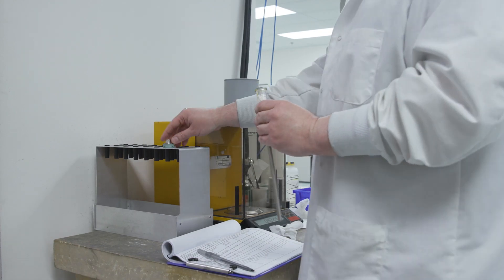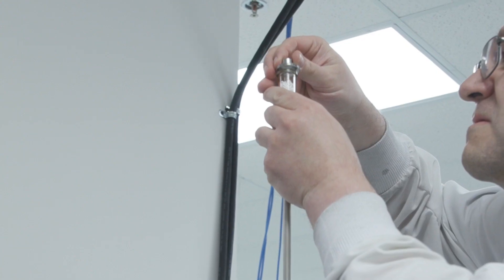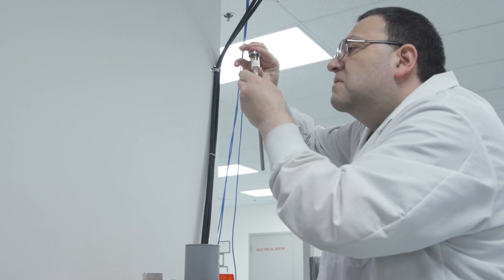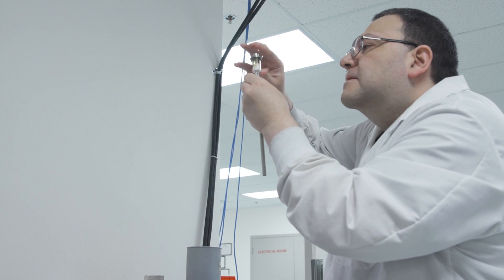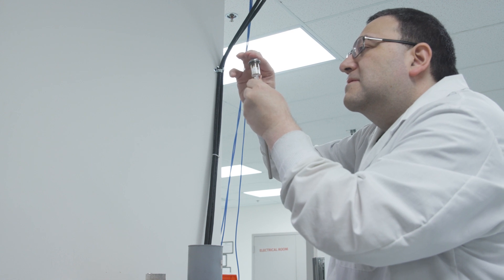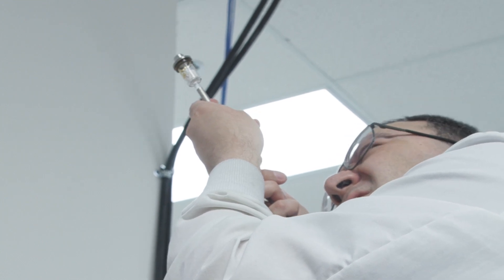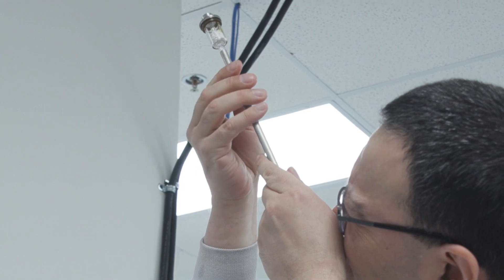He places the cap onto the top of the penetrometer and rotates it to spread the grease into a uniform layer around the outer edge of the sealing surface. He makes sure the cap is centered on top and evenly seated on the layer of grease. It is important that the grease is uniformly distributed under the cap and that there are no air bubbles present in the film of grease that could be points where the seal could leak. Chris holds the penetrometer up to look through the sealing surface and verify visually that he has a uniform seal.